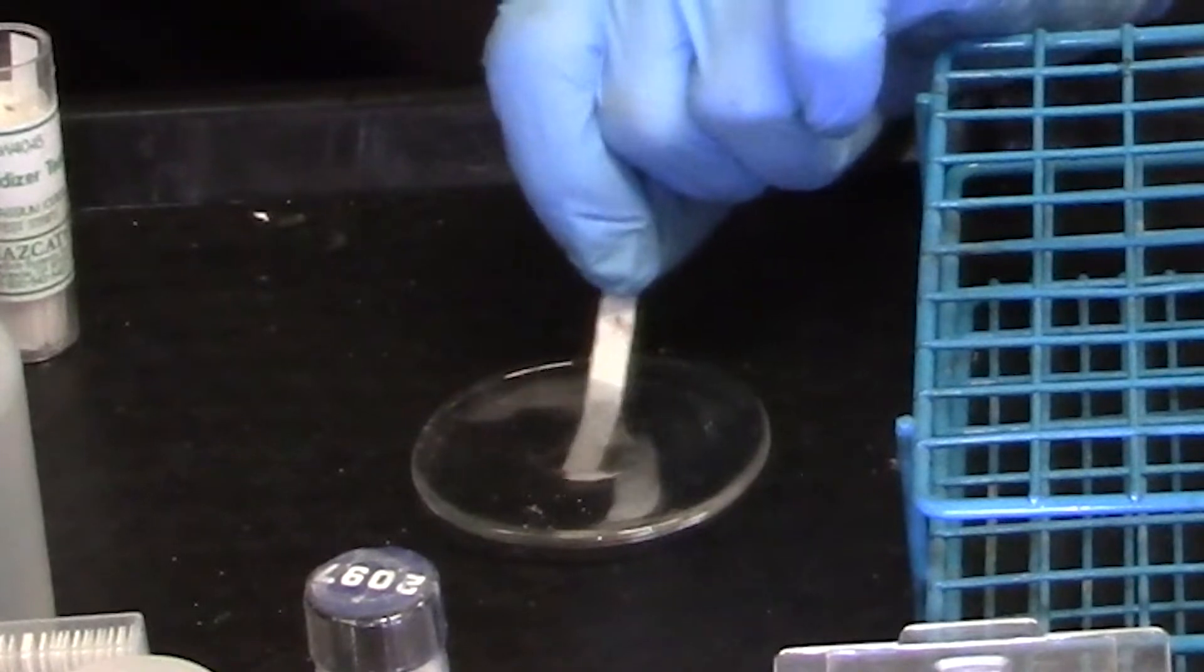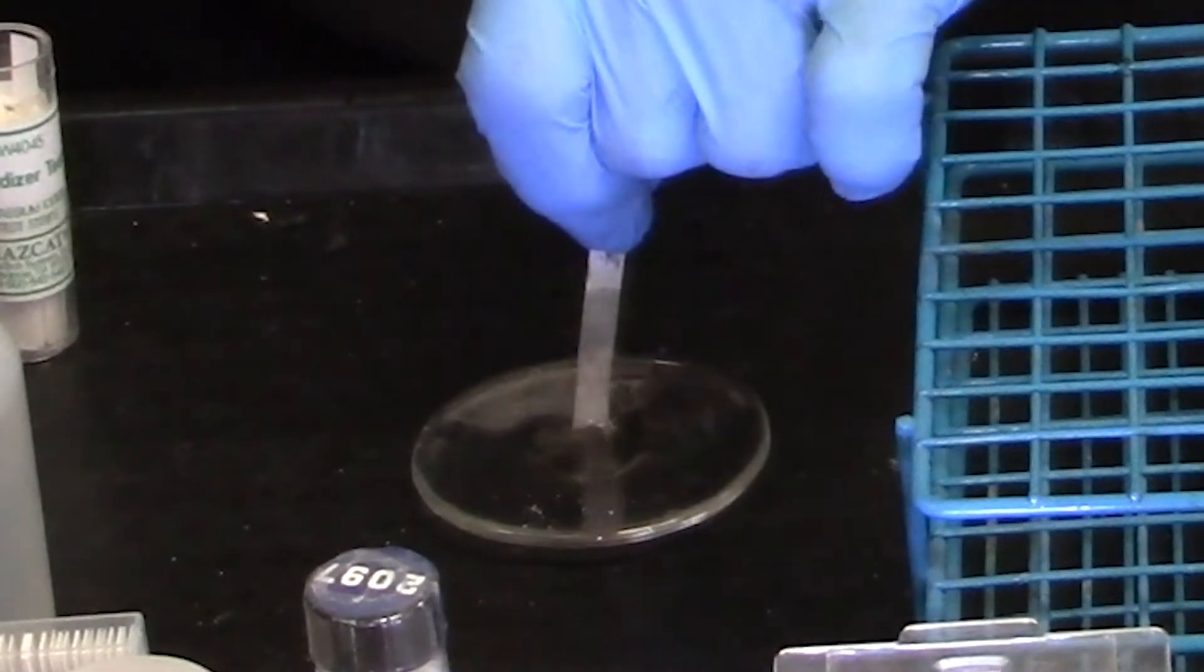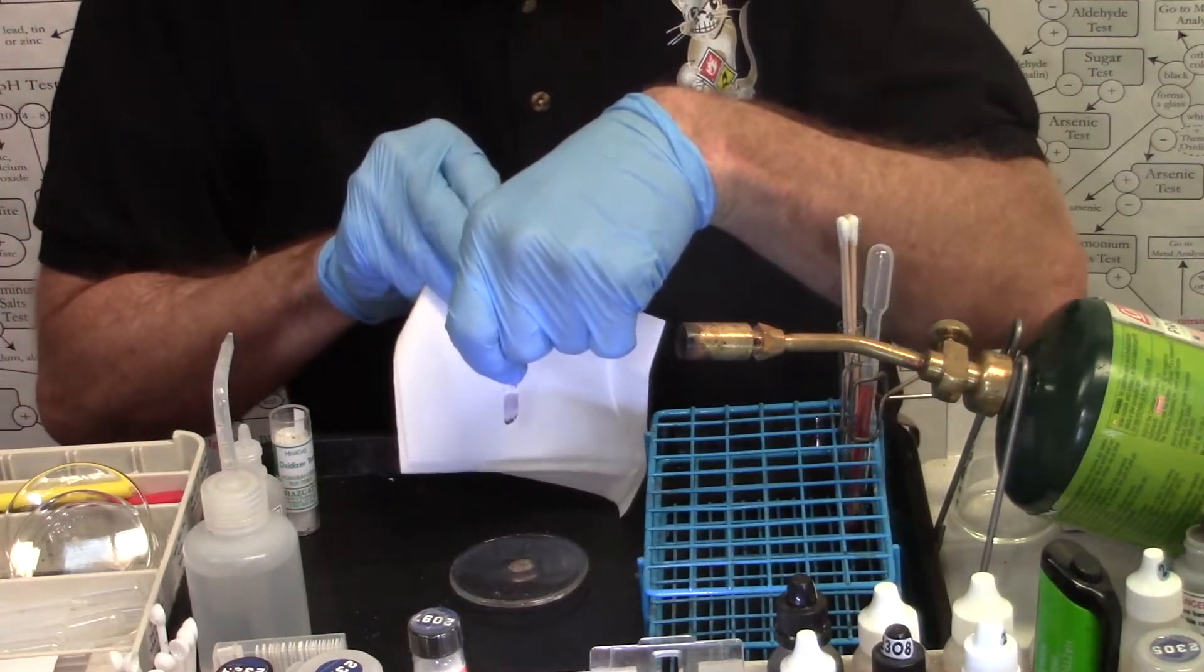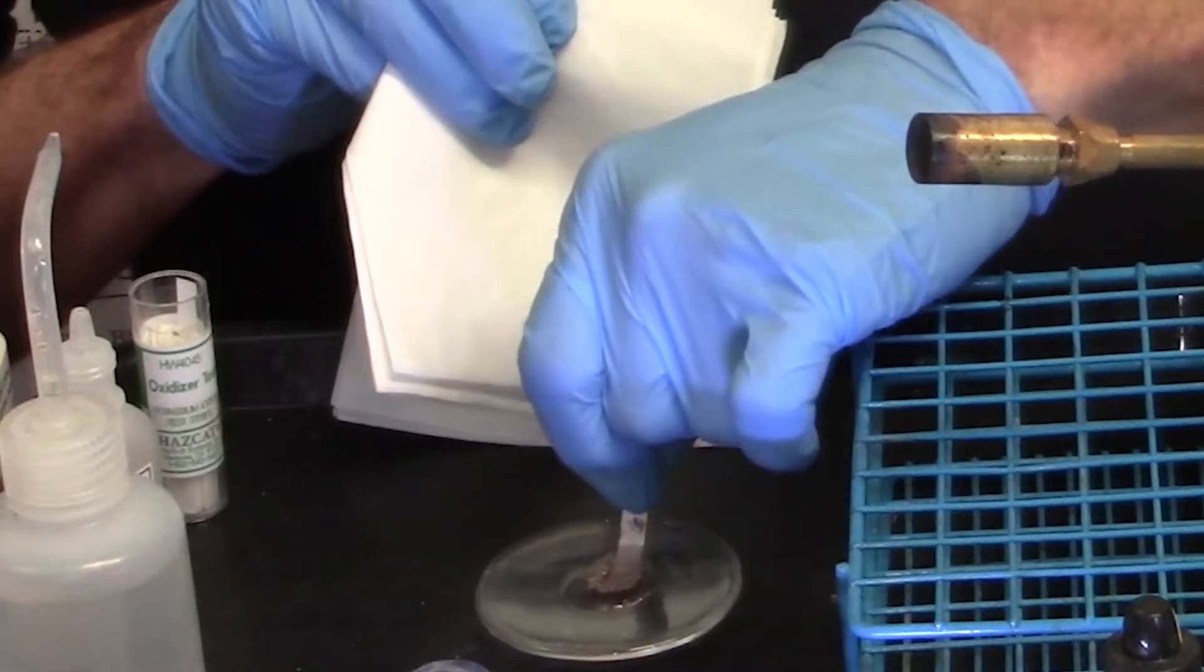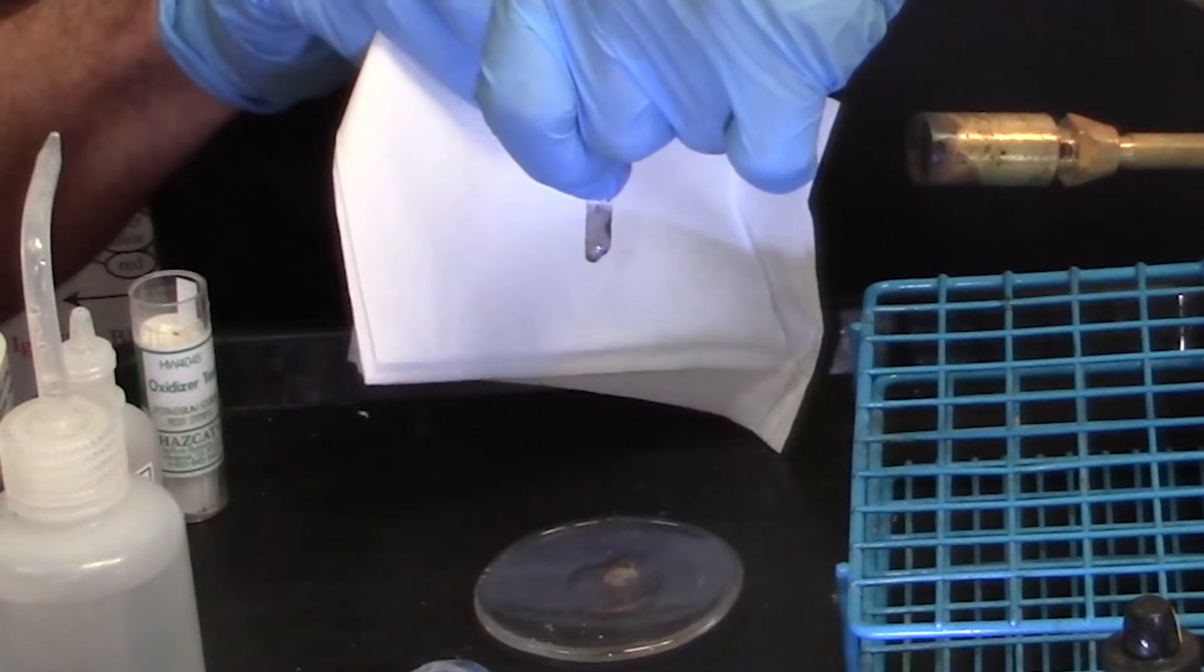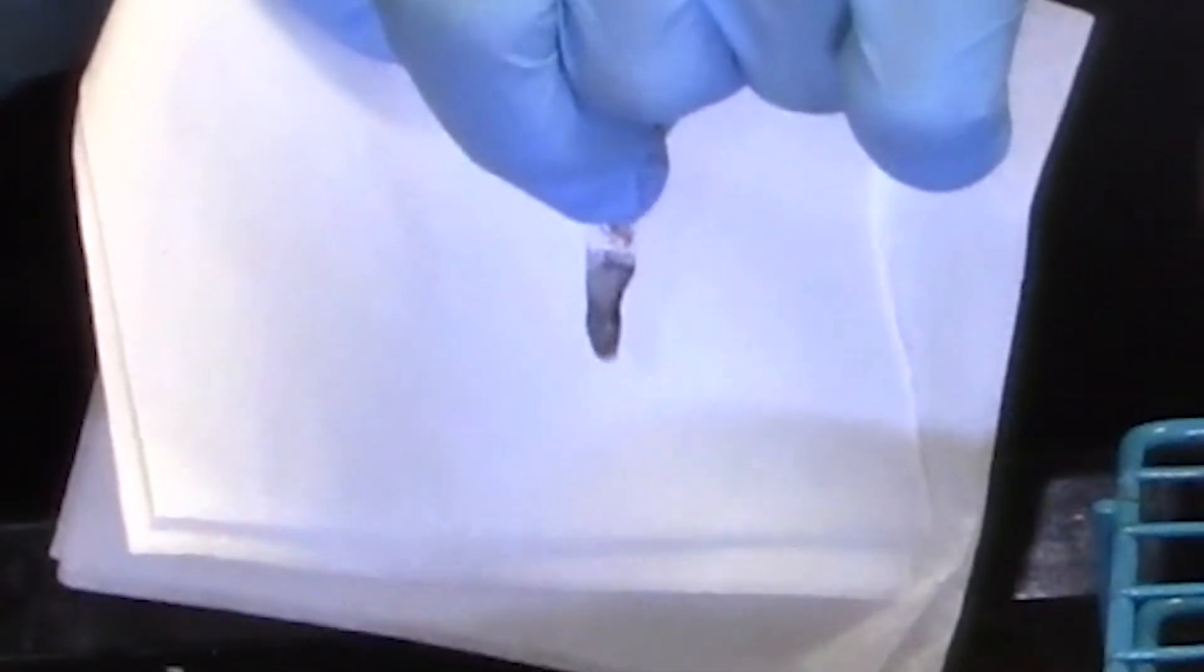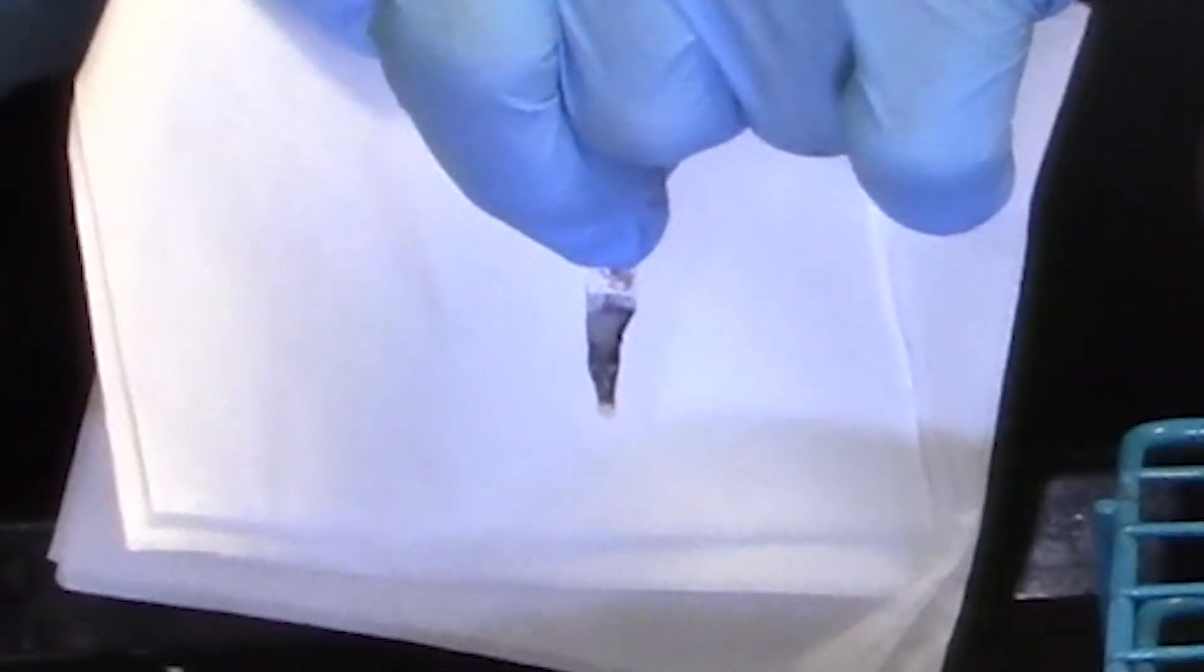And then it's one one thousand, two one thousand, three one thousand. Lift, look for two one thousand. And you can see this time, the unknown actually destroyed the paper, wilted it, turned it into a skinny black strip, turned it black.